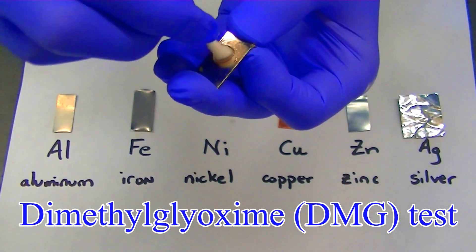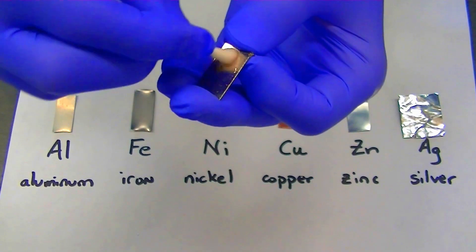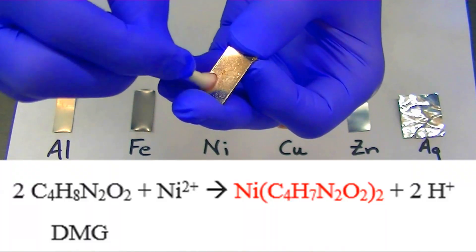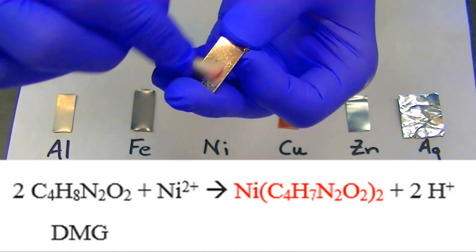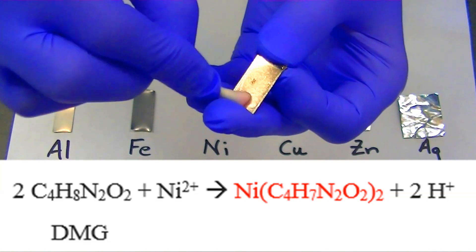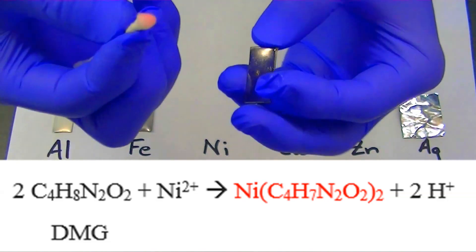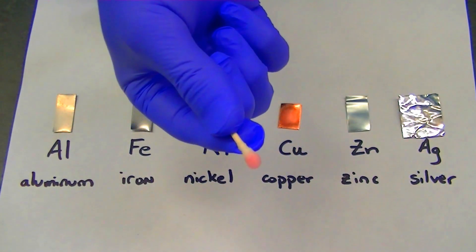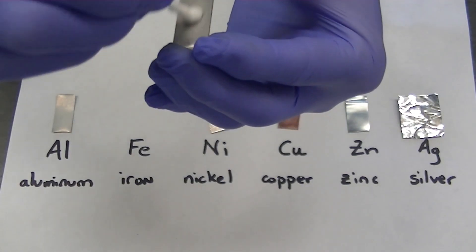In the dimethylglyoxime test, a 1% solution of dimethylglyoxime — also known as DMG — is rubbed over the surface of some nickel. Some ammonia is also added to the solution to enhance the reaction. Dimethylglyoxime will react with any nickel ions present on the surface of the metal to form a cherry red colored complex.